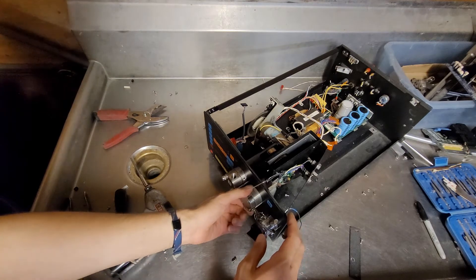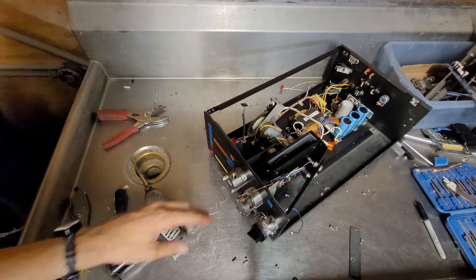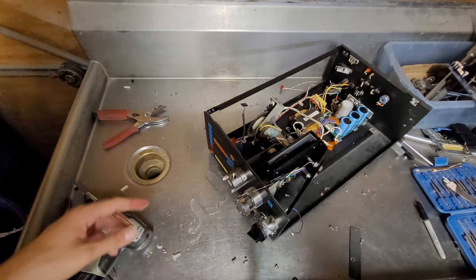I'm going to keep the safety glasses on. Well, I need to go wash my hands. I'll be back.